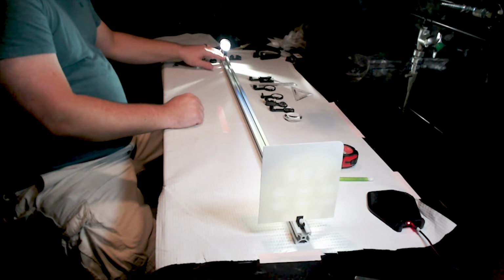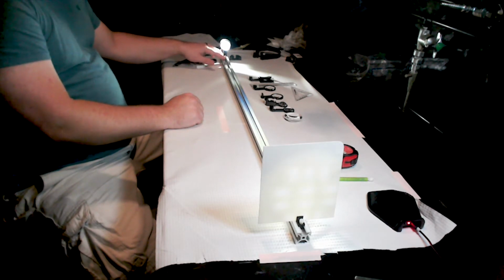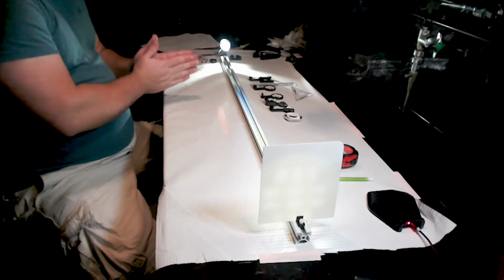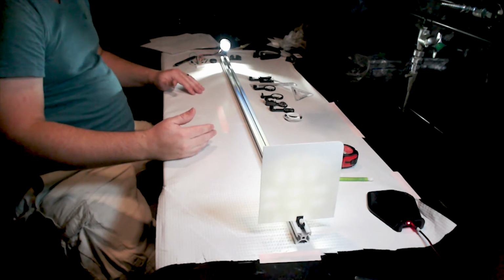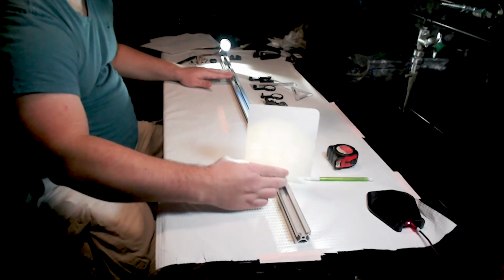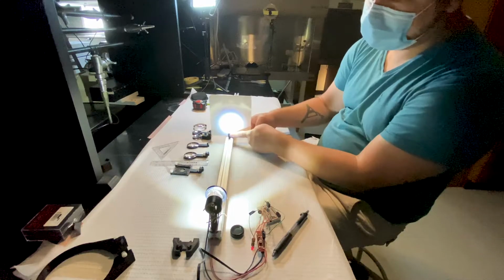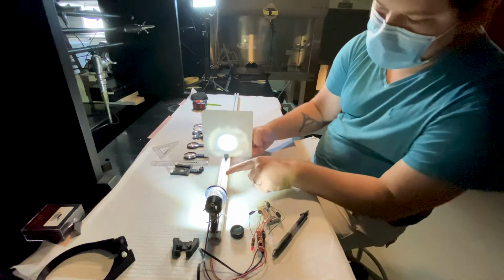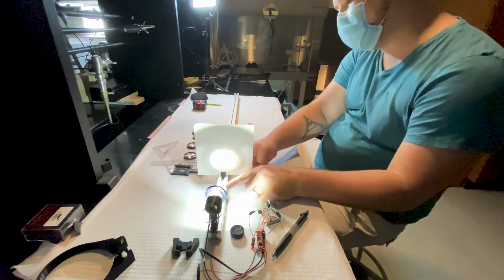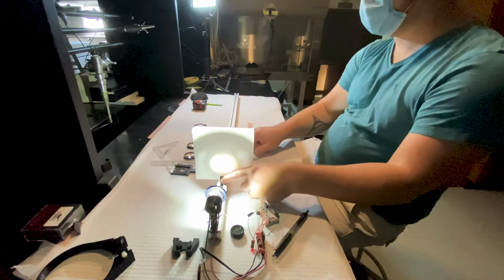Now, what you've learned in class is that you absolutely do not want this image of the LED on your sample, because that's not even illumination whatsoever. And you can see as I sweep this screen, okay, closer to that, this is a little bit more even illumination than it was out there. These things blur together.